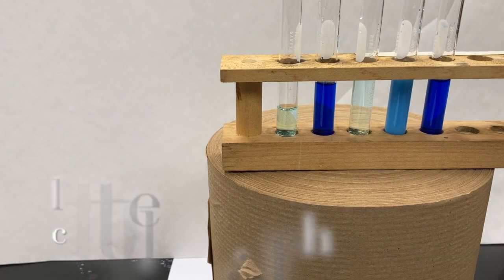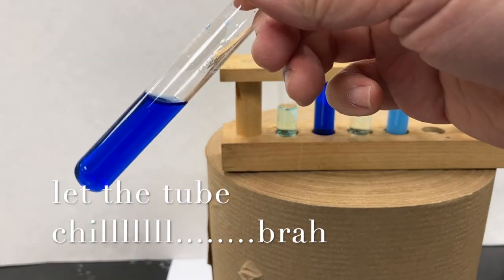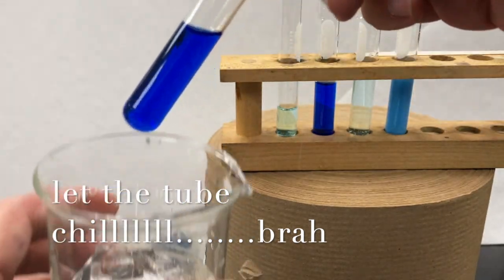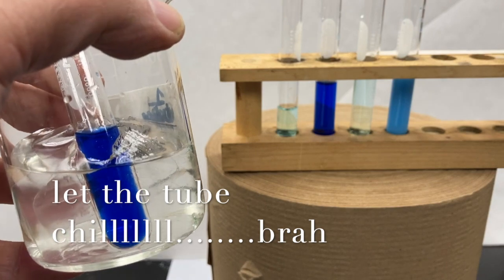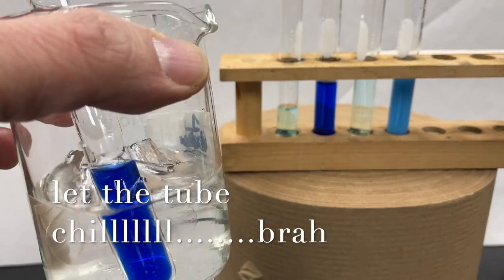For this last tube of this set, we're going to take our tetraamine copper tube and we're just going to let it chill. And we'll come back to see what happens to this guy after a few minutes.